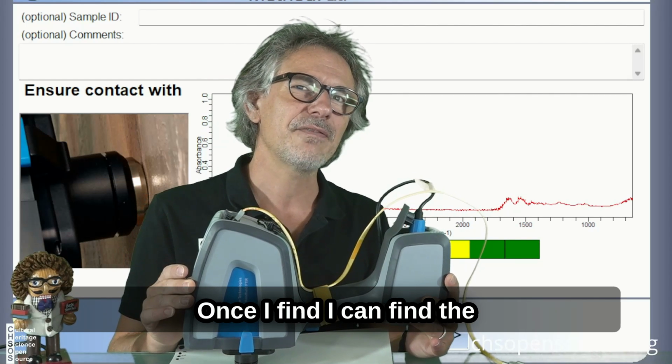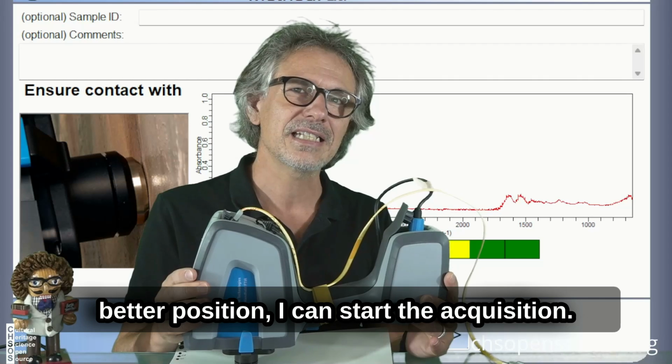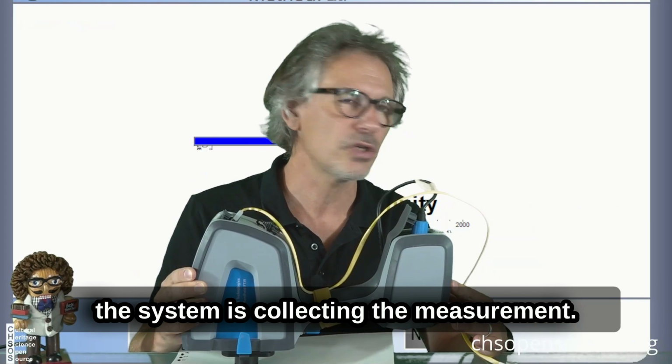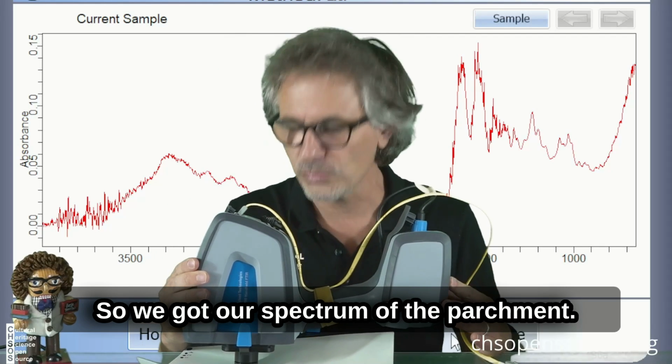Once I can find the better position, I can start the acquisition. So I click over here and the system is collecting the measurement. And there it is. So we got our spectrum of the parchment.